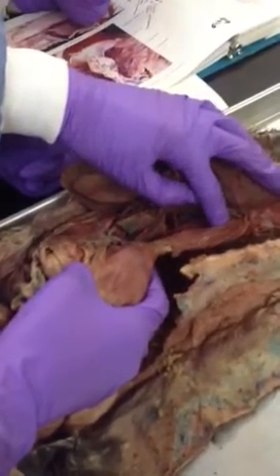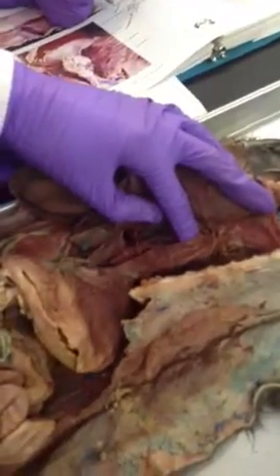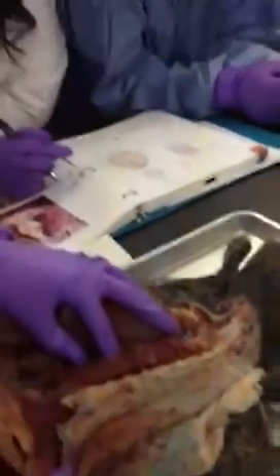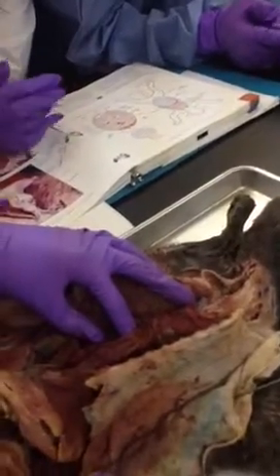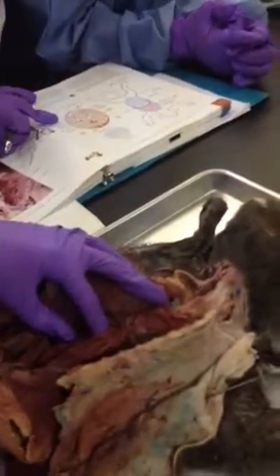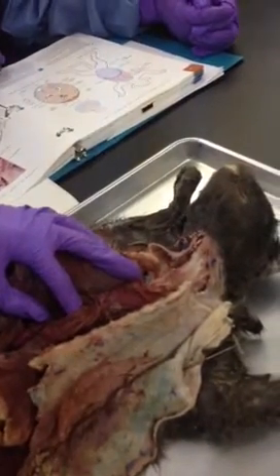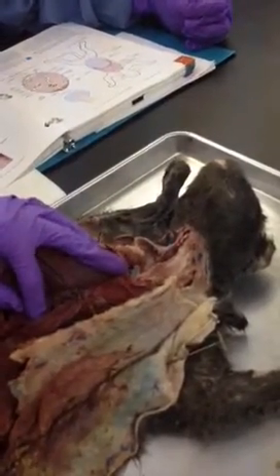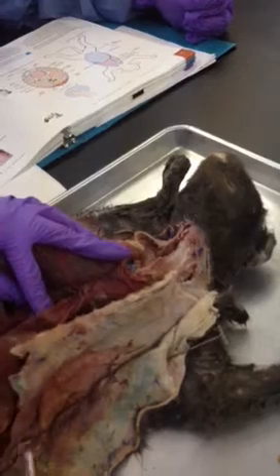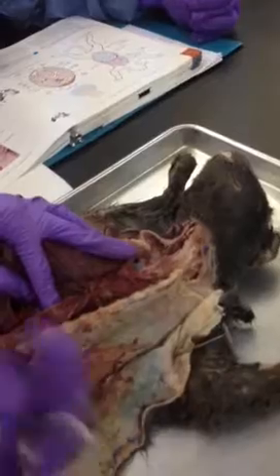What empties into the esophagus? Let's clear this up. I don't ever want air and food mixing, if I can prevent it. Because what would happen? I would choke, right? Or when they say someone aspirated, that means something that's not supposed to go in the airway went down. So aspiration is not a good thing. So what empties into the esophagus? Pharynx. What are the 3 parts of it?